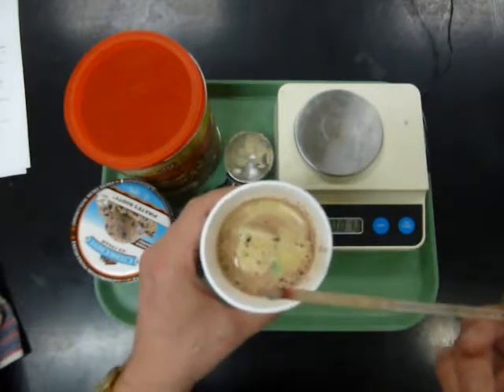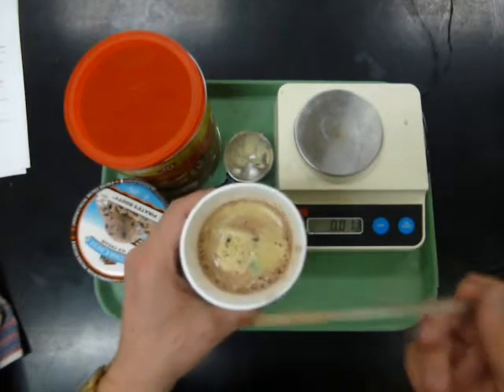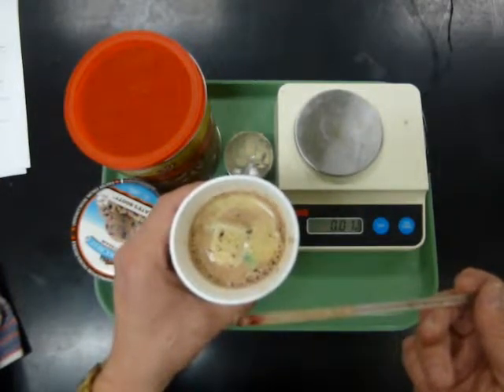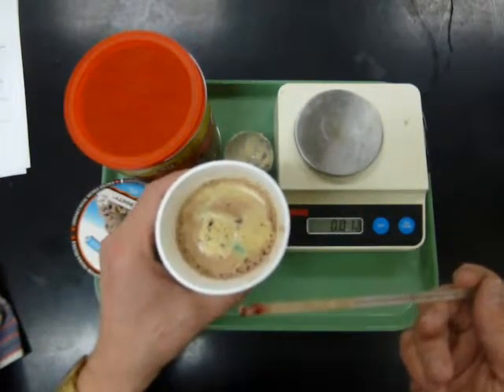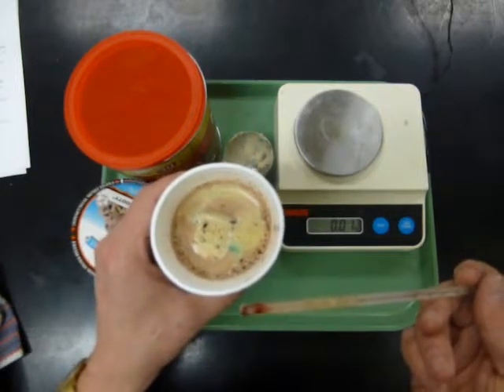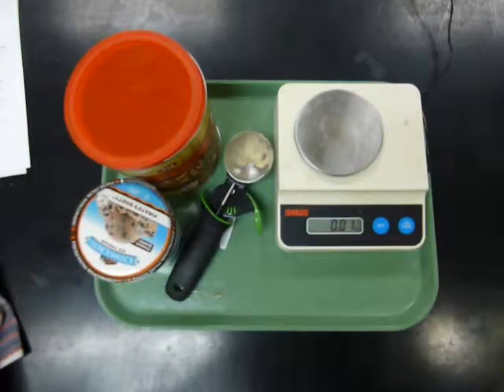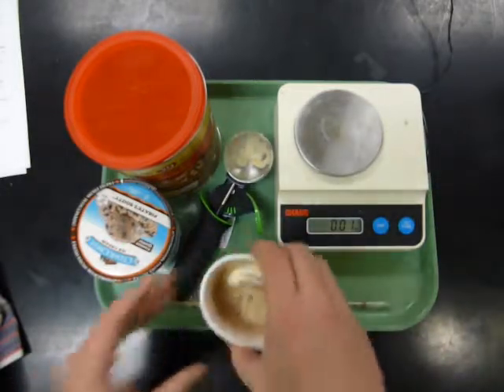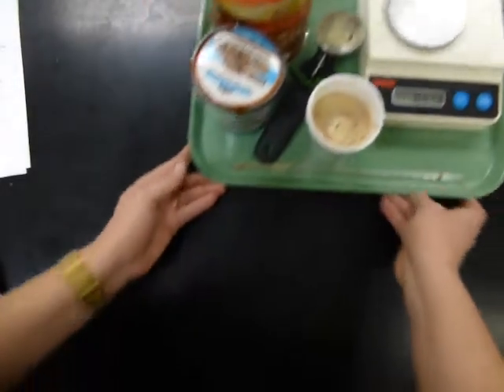And then when it's all done, I'll give you cleanup instructions. The measurements that you make, you'll need to use to fill in a data diagram and do the calculations. All the materials will be food safe. So when you're done, this can be consumed. That's good stuff. Now, let's look at the other experiment.